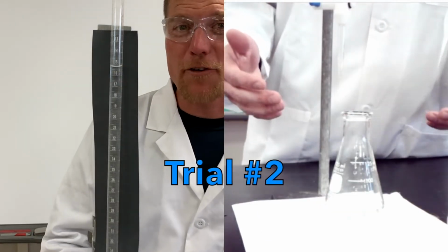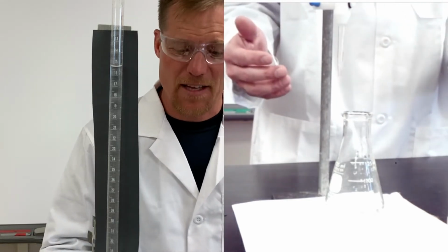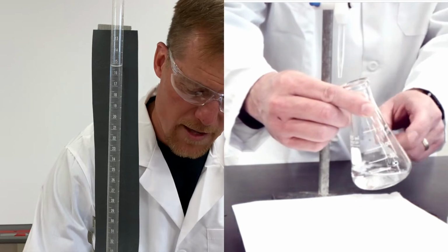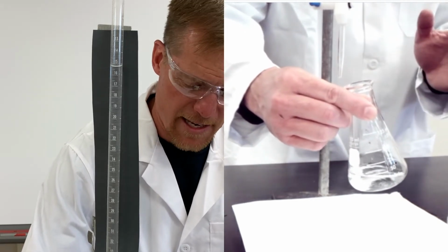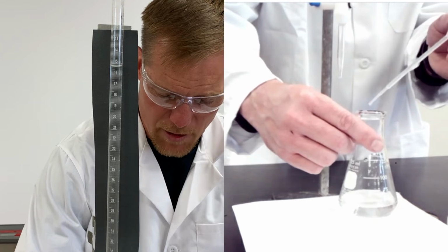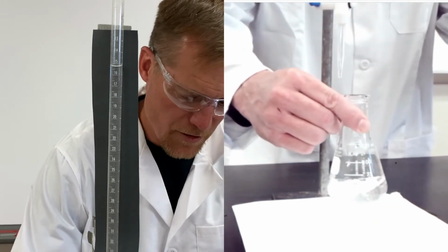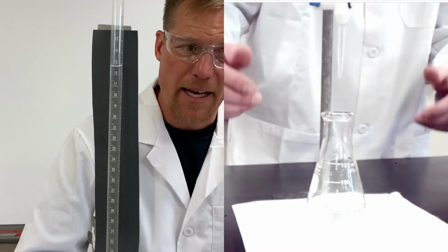All right, so now for your second and third trial, you're just gonna do the exact same thing, all right? I have already dumped out our last trial. Acid, base, phenolphthalein, completely dumped, completely rinsed, and rinsed out with distilled water. And now I have my 20 milliliters of distilled water in there. I'm of course going to add my 3 drops of phenolphthalein. So I've got my indicator in there, give it a little bit of a swirl, and I have my acid ready to go. I'm gonna add my acid.